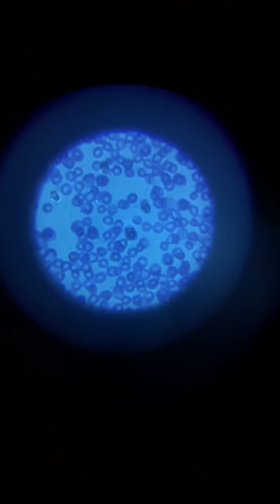So this was a little quick run-through of what we can use a microscope for. I hope you enjoyed this and were not too grossed out by some of the slides.